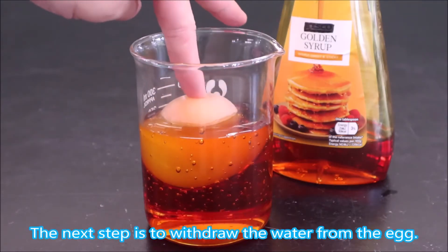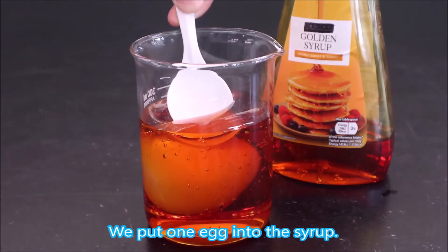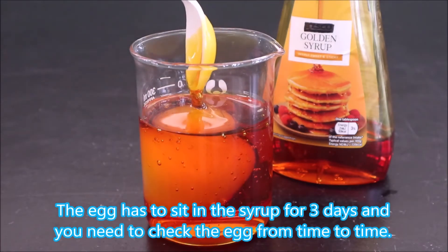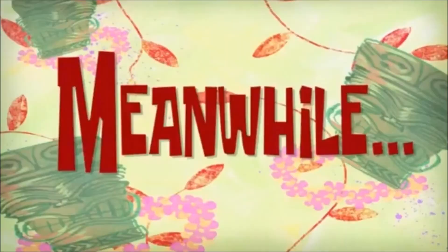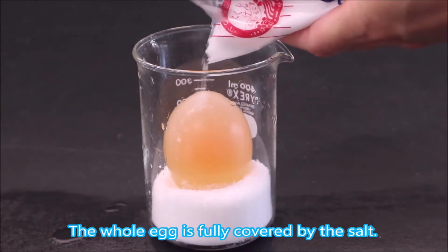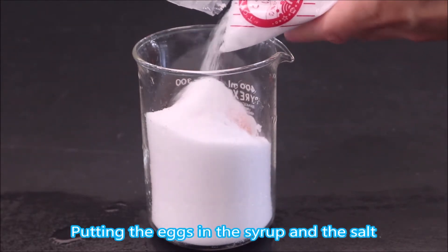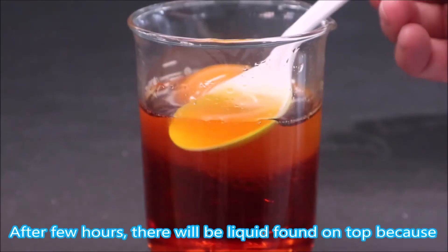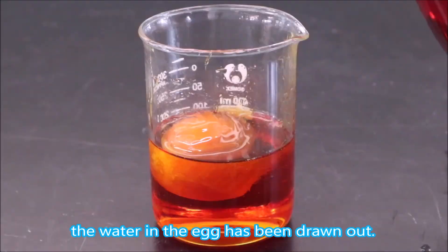We are not done yet. The next step is to withdraw the water from the egg. We put one egg into the syrup — remember to gently submerge the egg. The egg has to sit in the syrup for 3 days and you need to check it from time to time. Apart from putting the egg into the syrup, we put another egg in salt. The whole egg is fully covered by the salt. Putting the egg in syrup and salt is like making dry food such as saltfish. After a few hours, there will be liquid found on top because the water in the egg has been drawn out.